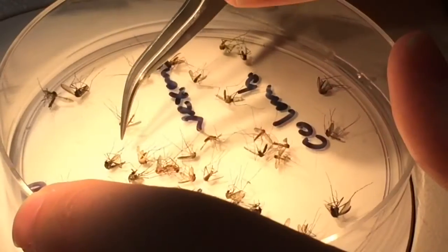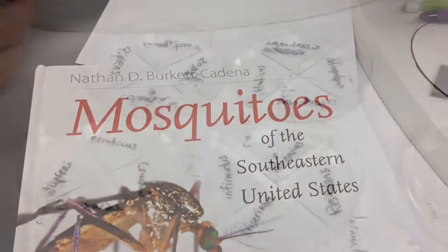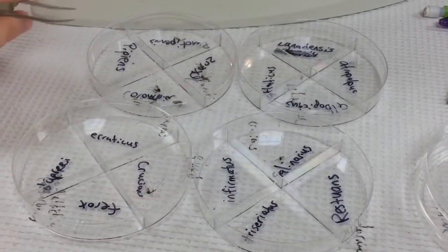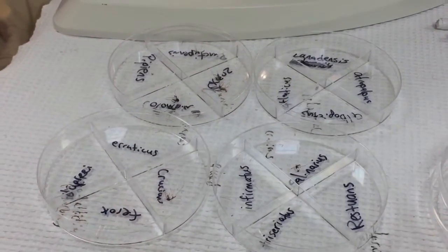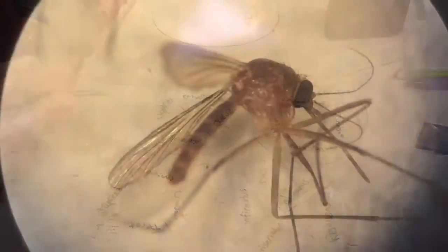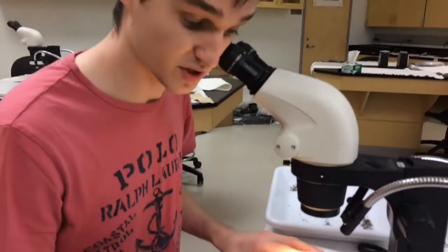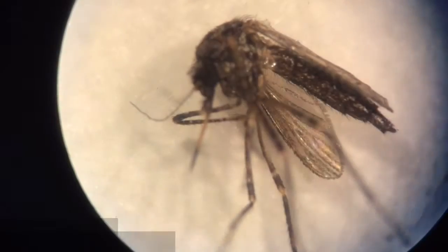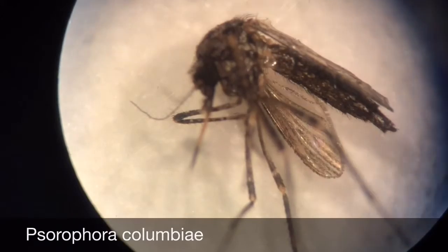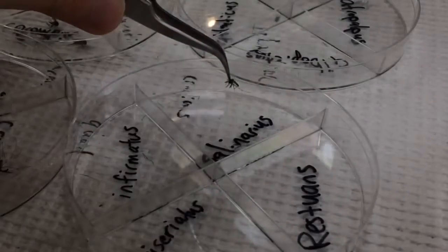There are about 66 different species of mosquitoes in North Carolina. These are some of the common ones I usually find — I separate them into the petri dish first, then count them and record them into an Excel spreadsheet. Some common ones I see are Culex pipiens, Culex quinquefasciatus, and Anopheles punctipennis. Right now the Uranotaenia sapphirina population is really high, though every now and then you'll get some rare ones not often seen in the area.